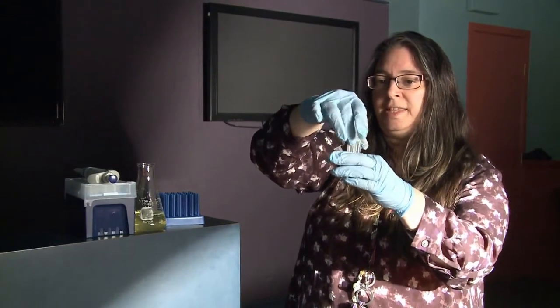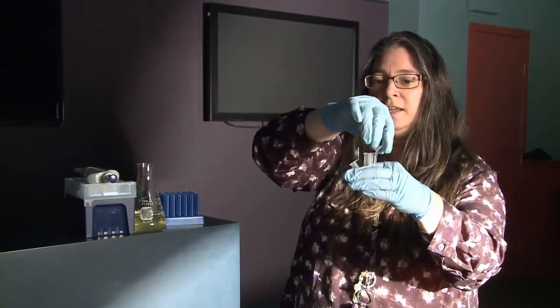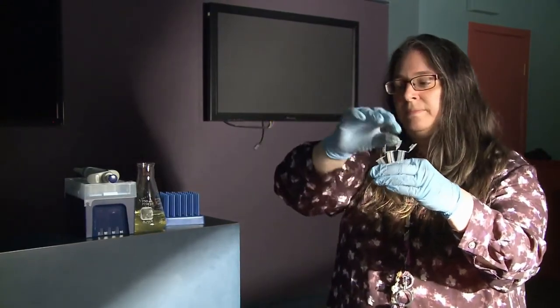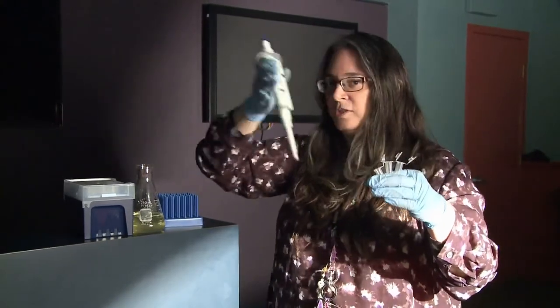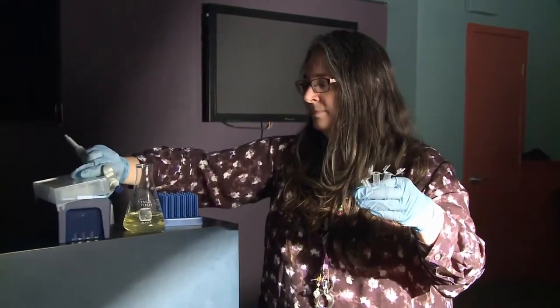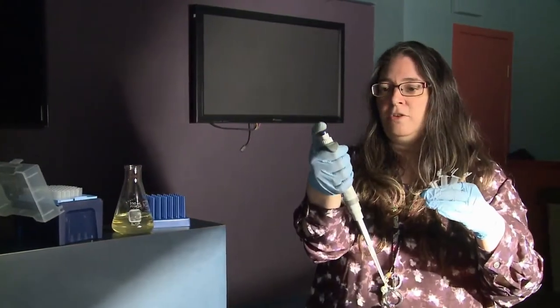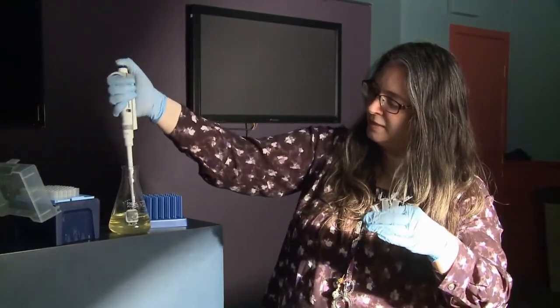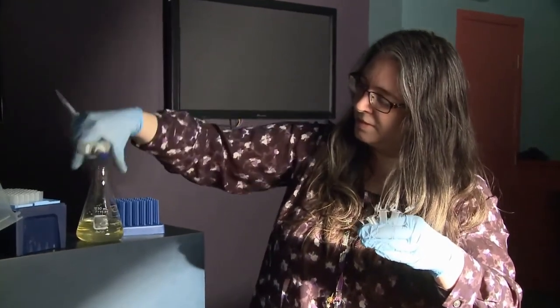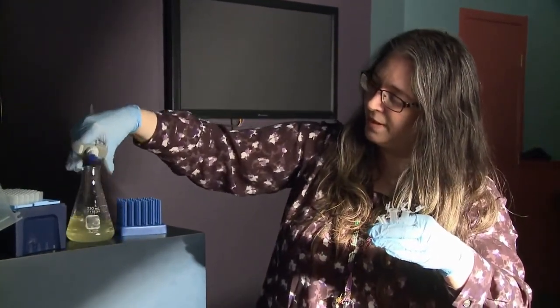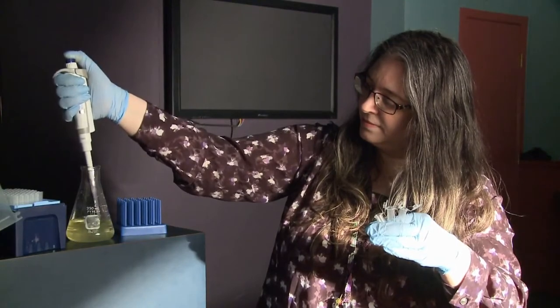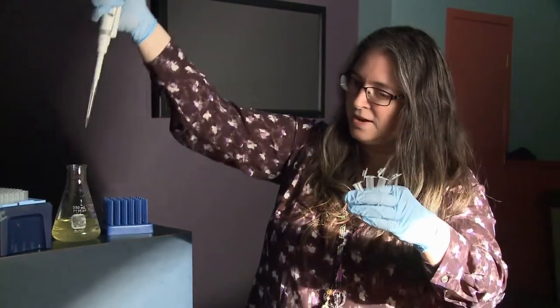Hold them like this so you guys can see what I'm doing. And I'm going to use a pipette to add my luminol. There we go. So I'm going to collect some luminol. Take a little shake first.